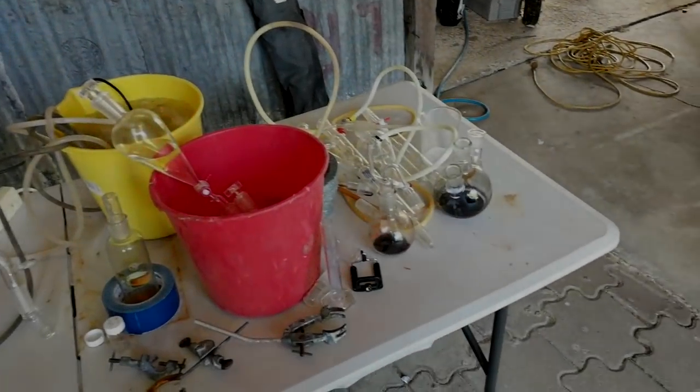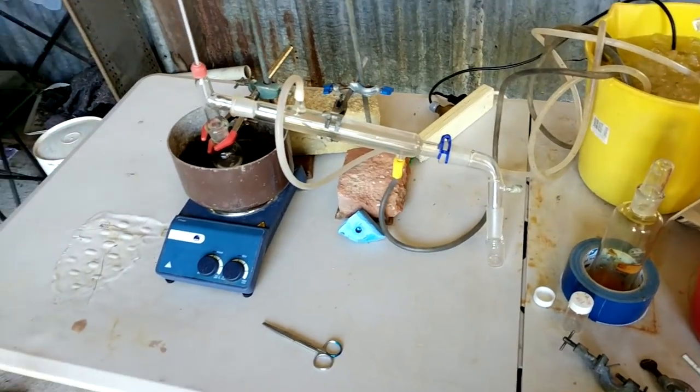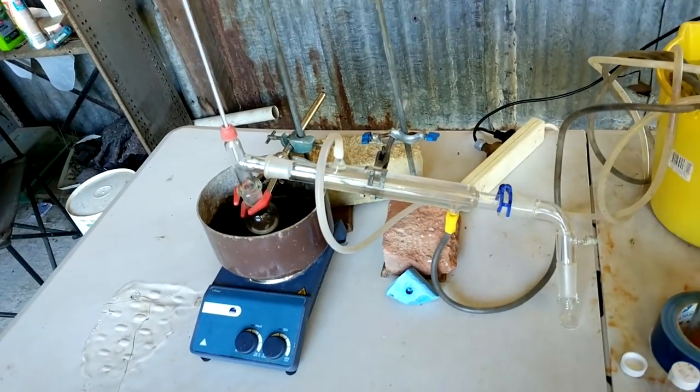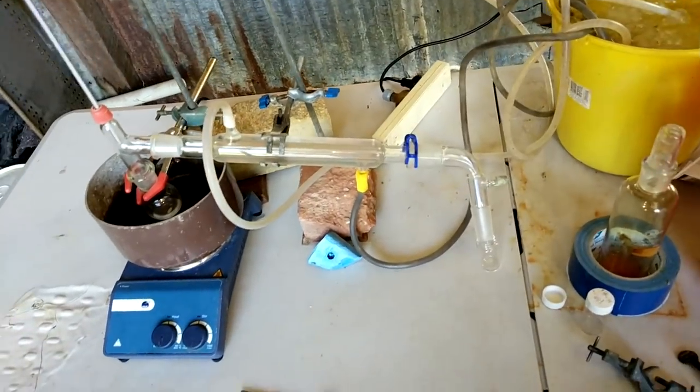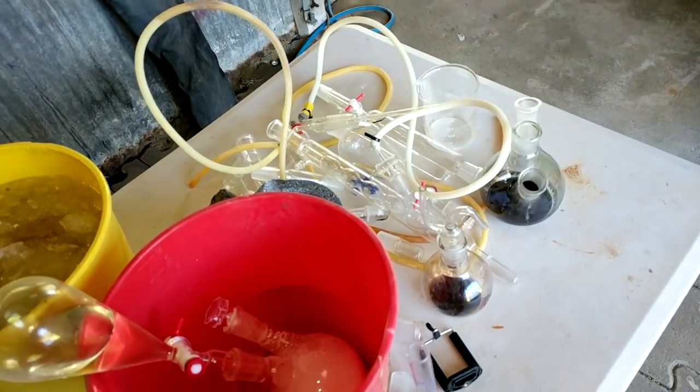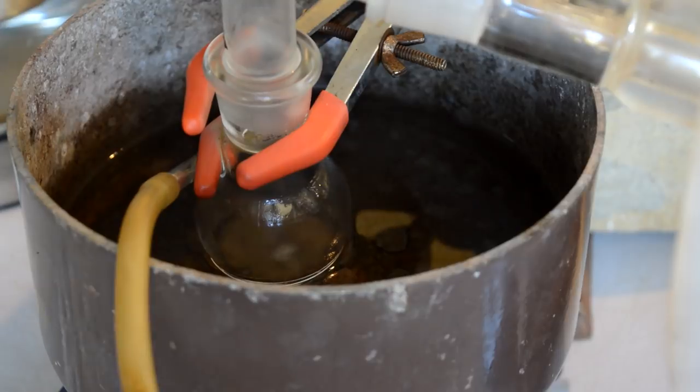All right, here we are the next day, big pile of glassware. I don't have to clean, not looking forward to it. I've just got simple distillation set up. I'll put the hot water in there. It doesn't smell as bad as previous ones have been. I'm definitely a lot less sharp, so I don't know what that means. I won't read too much into it. Let's just do the experiment, I guess. We're just distilling it into one of these vials because it's better than creating more glassware for me to clean later on. It's actually boiling.